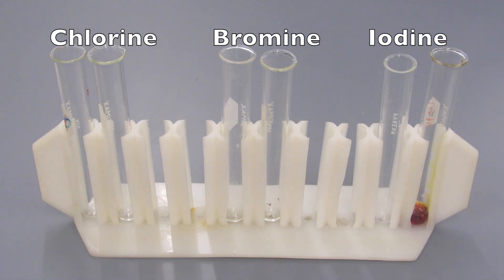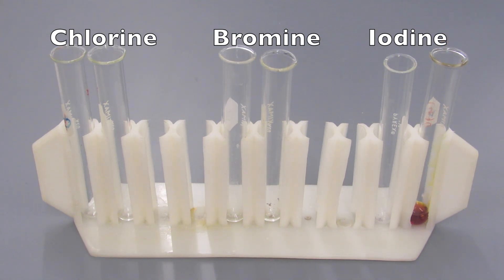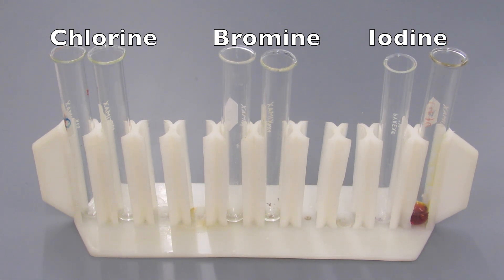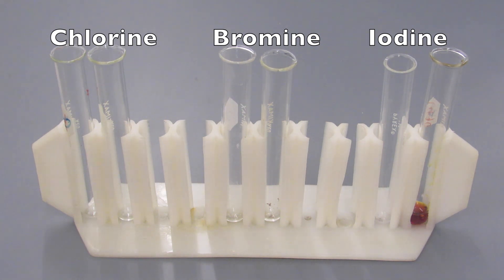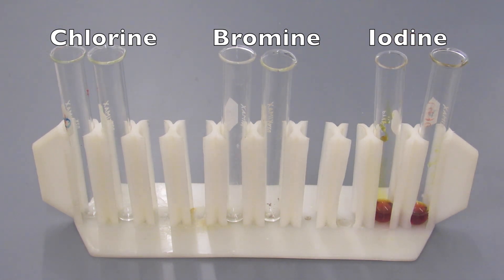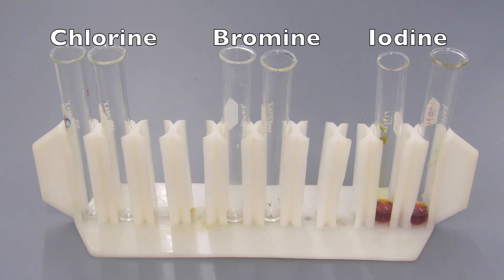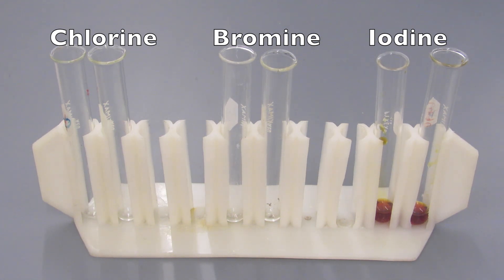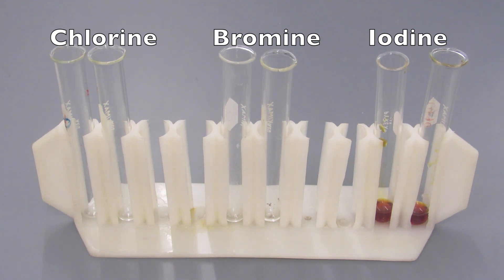We're taking the elemental form of these elements — so I2, Br2, and Cl2. Each of these elements are dissolved in a little bit of water to make all of these solutions aqueous solutions.